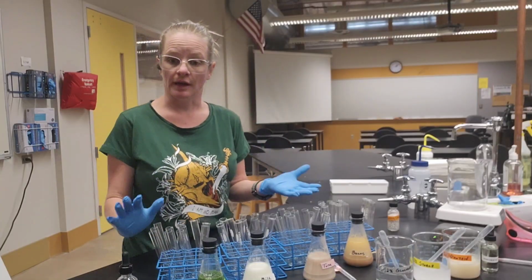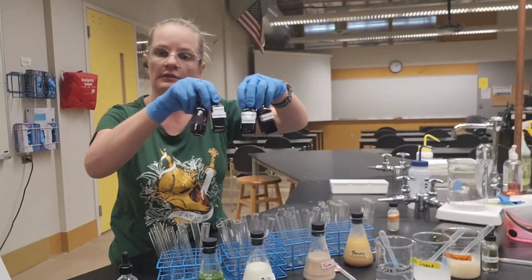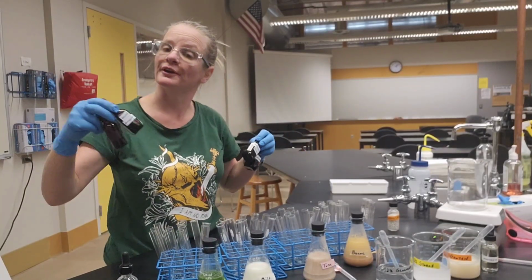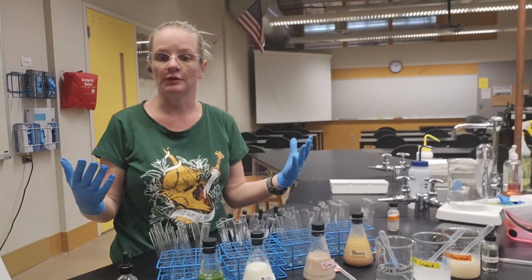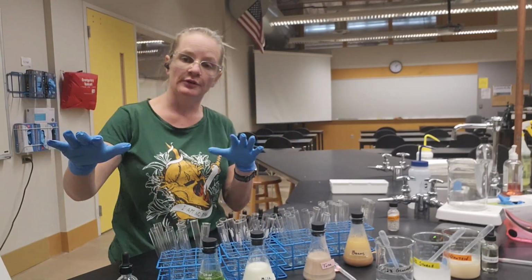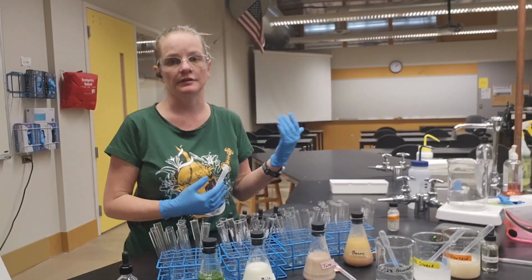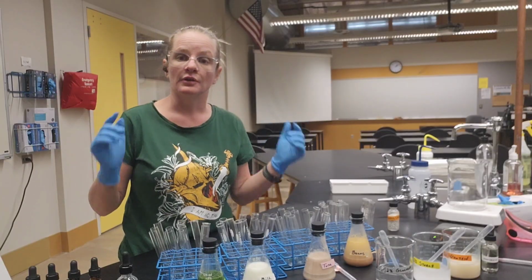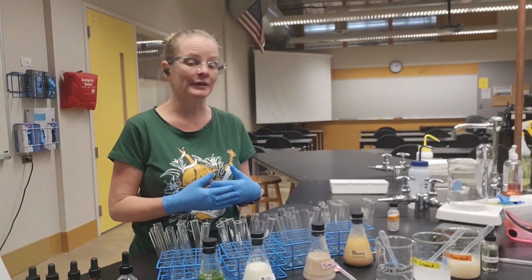Now, I'm going to set up the lab for you. The indicator solutions that we're going to need for this lab are carcinogenic, so that's why I'm doing it here, where I have gloves and goggles and all the safety equipment around me. But you're going to have access to all the data, and so you can do the same analysis that you would if you were actually in the classroom physically. So our first indicator solution that we're going to use is activated only when it's heated.